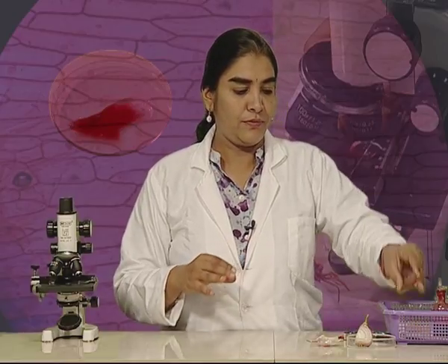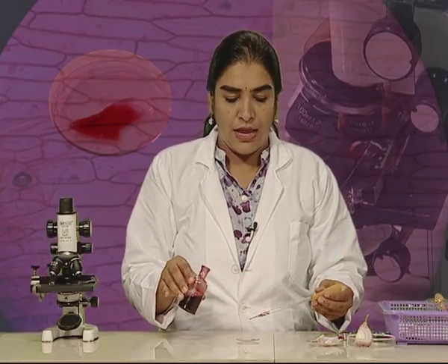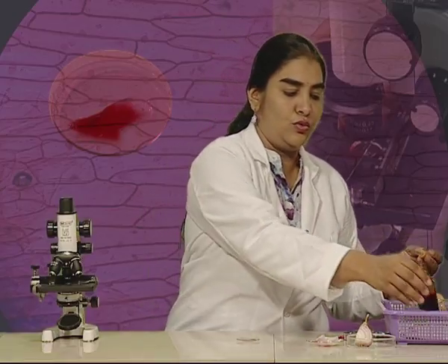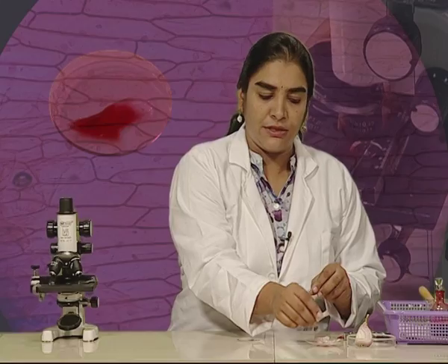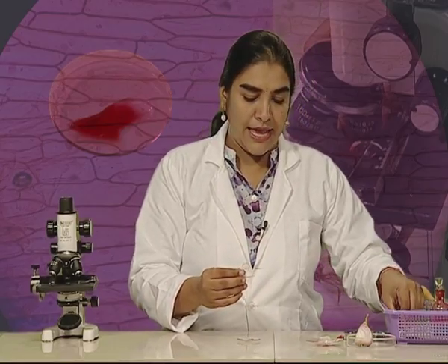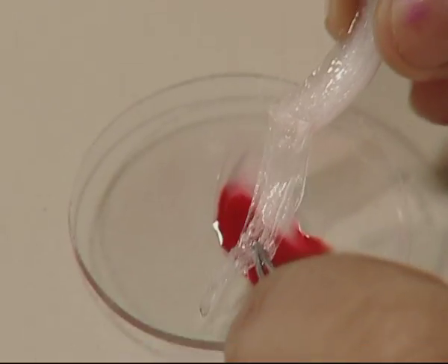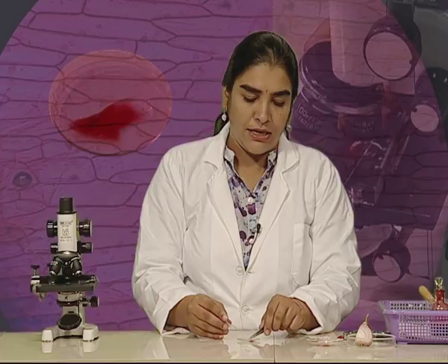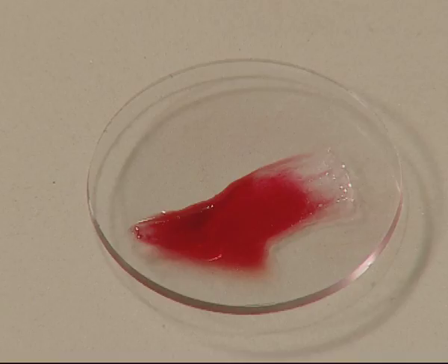Now let us see the procedure of making the temporary mount. First, take a watch glass and add a drop of water to it, then add a drop of safranin stain to the water. Make sure to cover the stain bottle after use. Now take a piece of onion and with the help of a forcep, take out its peel. Keep this peel in the mixture of stain and water for about one to two minutes.